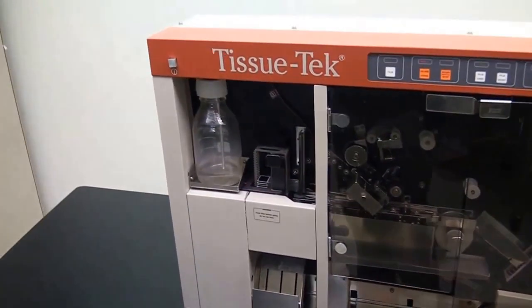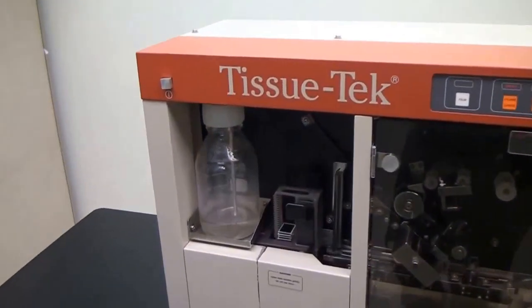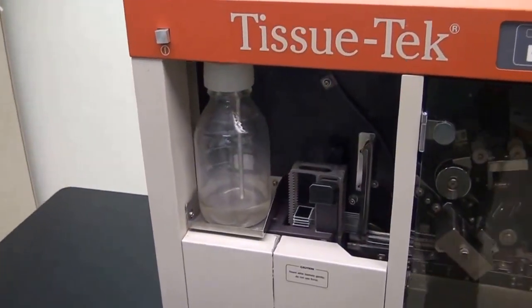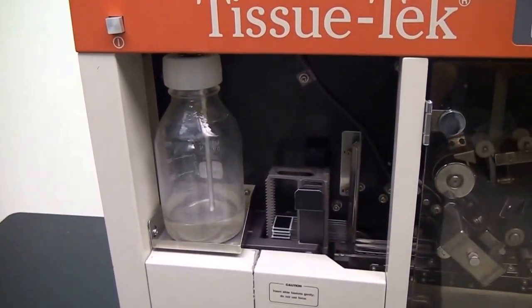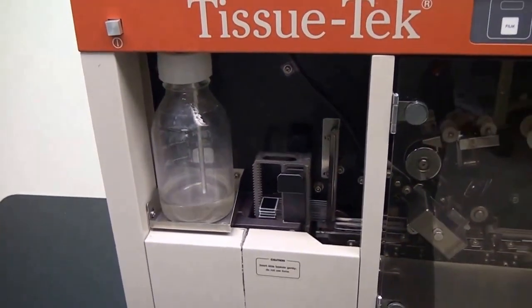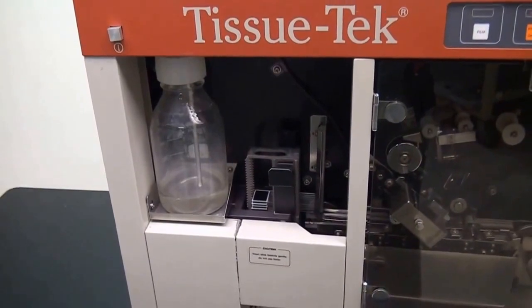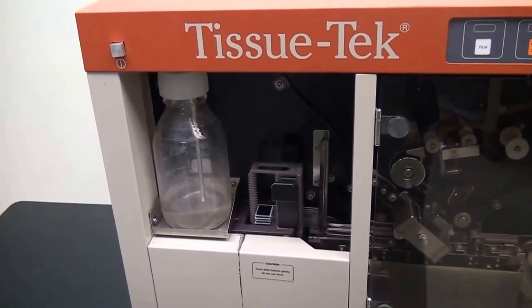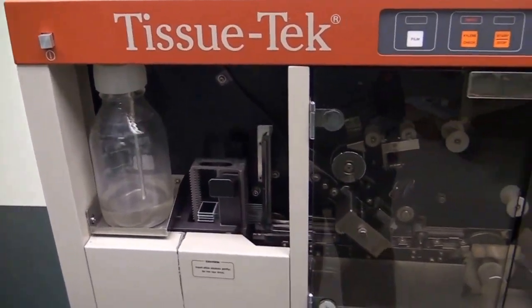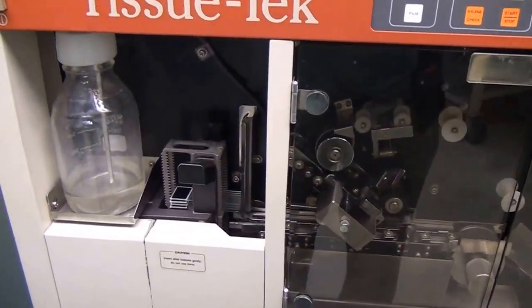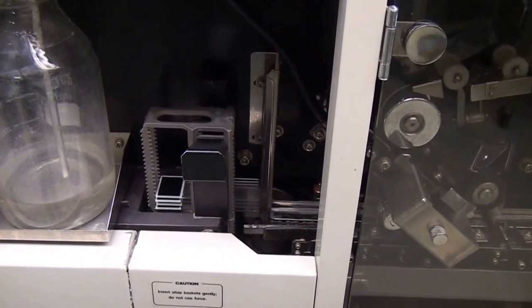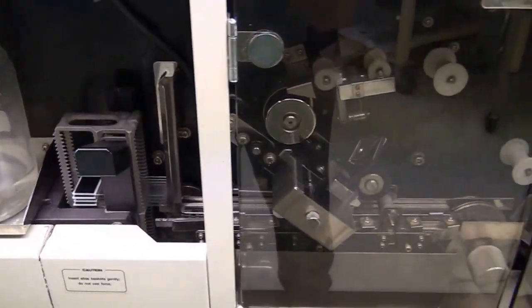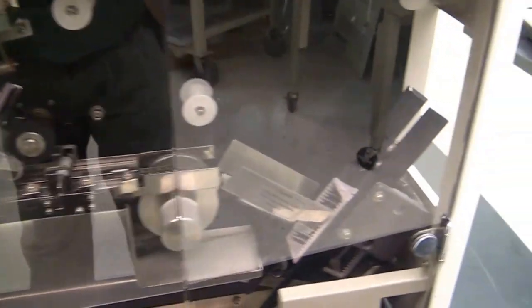We replaced the pressure bottle and the Xylene applicator, and also the pump that pressurizes the bottle. As you can see, we have it set up here with some slides and a basket on each end.